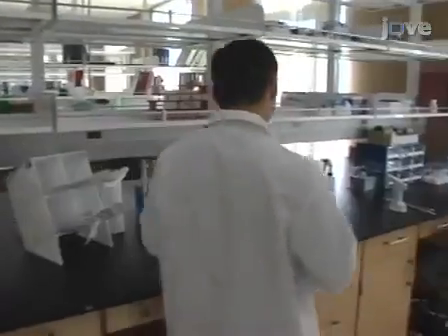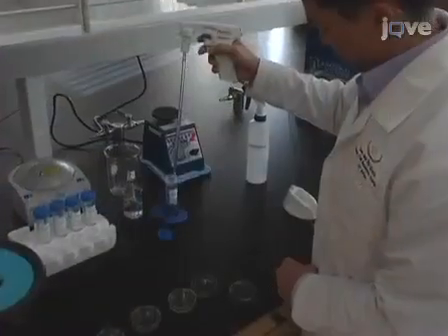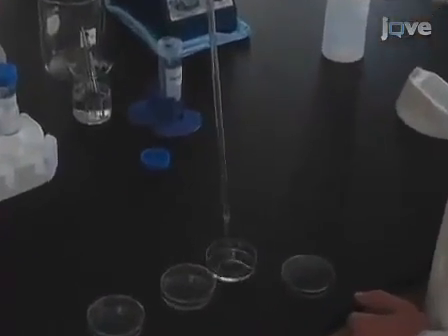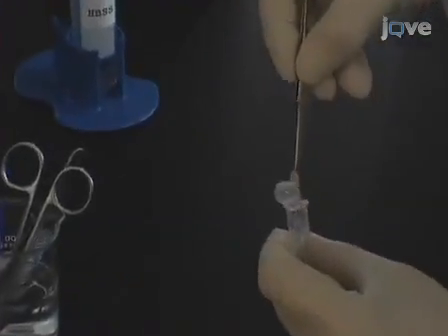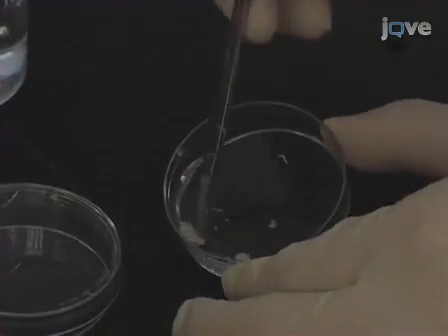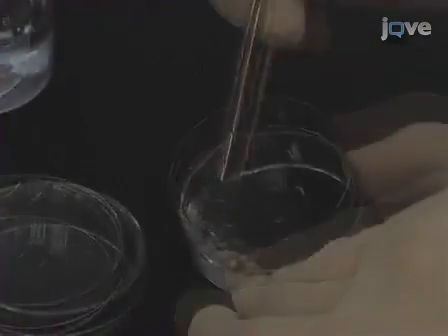Begin the dissociation of the spinal cord tissue by putting Hanks buffered saline solution, or HBSS, in a petri dish. Then, using fine scissors, mechanically dissociate spinal cord segments T8 through T10 of uninjured control or contusion-injured spinal cord tissue at T9.